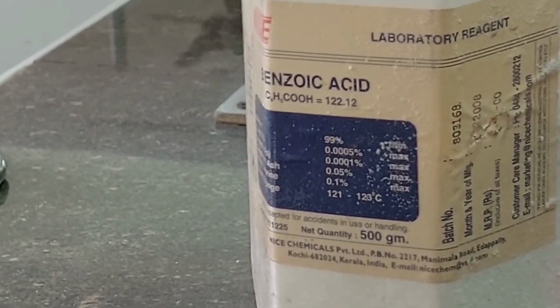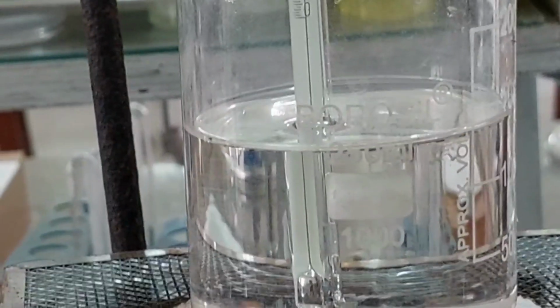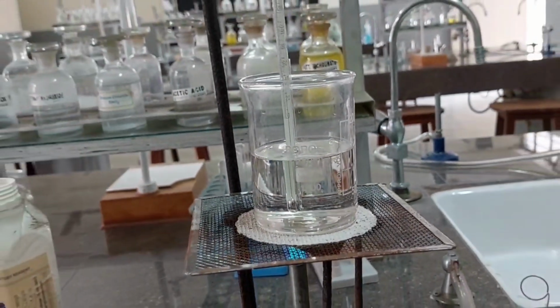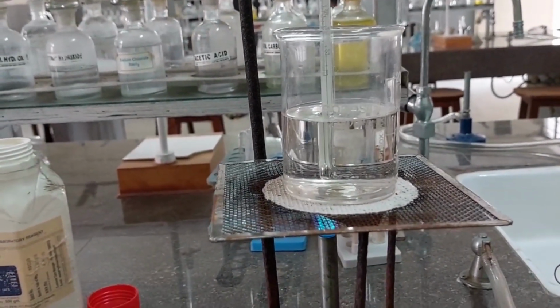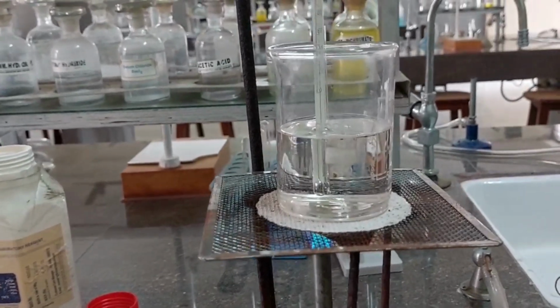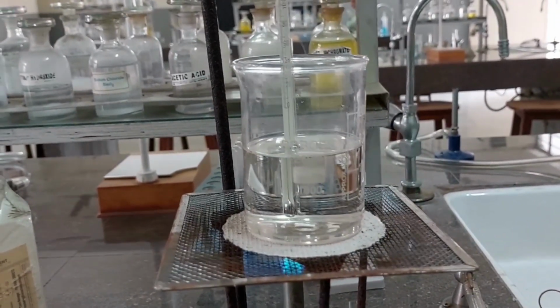So what are we going to do? We are going to take the sample once again, repeat the entire process once again, fill a new capillary tube and then take the second reading for melting point, and then the average of 2 will give us an idea of the actual melting point of this substance. If the melting point is not as quoted in the tables, that means this is an impure substance.